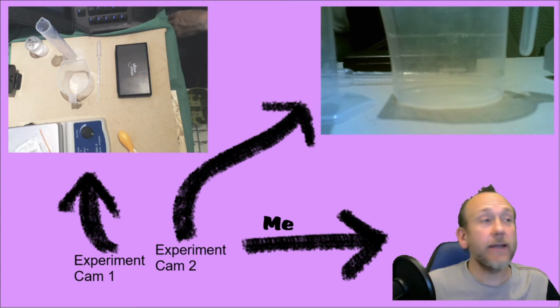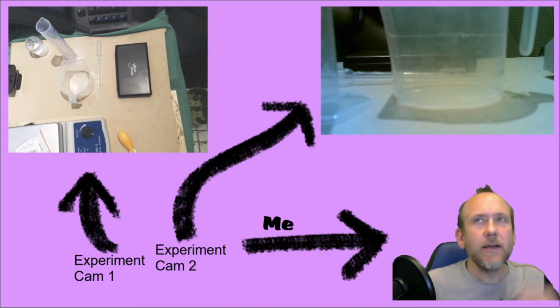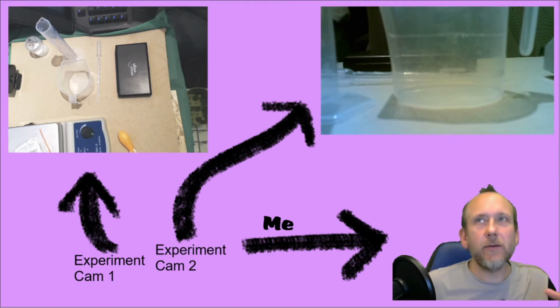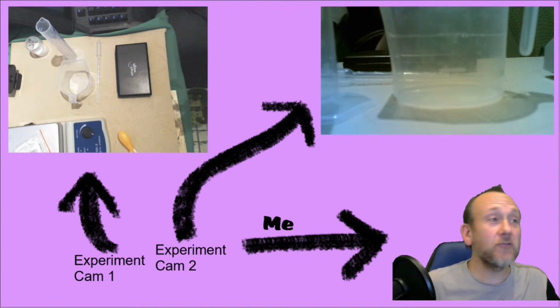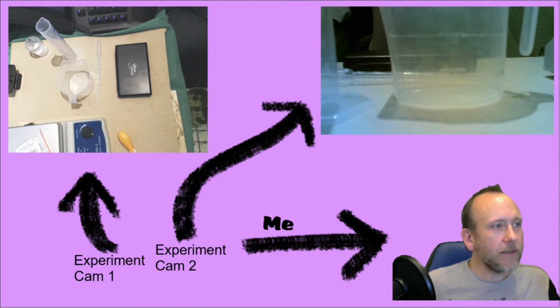Gleisner, and today I thought I'd address a question which is, of course, at the forefront of a lot of people, which is how much acetic acid is there in vinegar? Wait for it. What I'm aiming to do with these experiments is really to give power to everyday people and A-level students, I guess, who are interested in molar calculations as well. And I want to show you that with a little bit of care and thinking about things, you can analyze things.